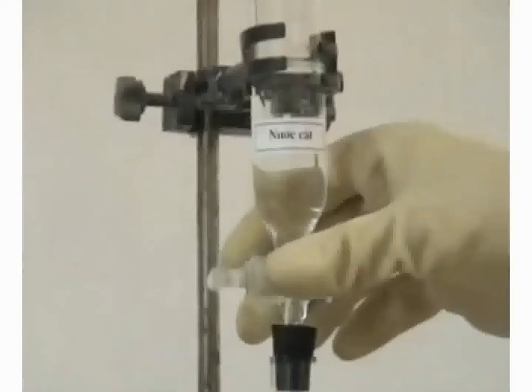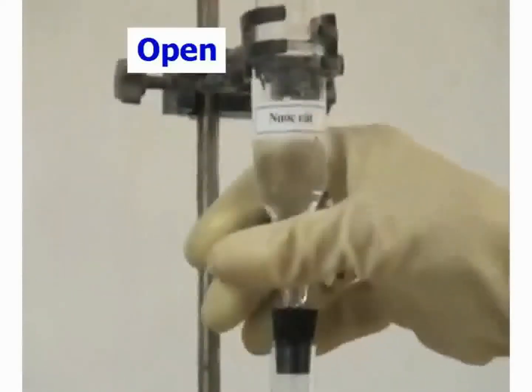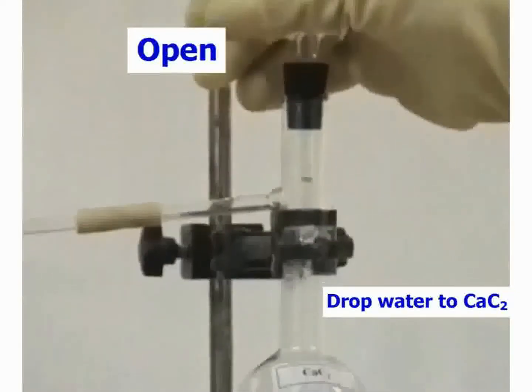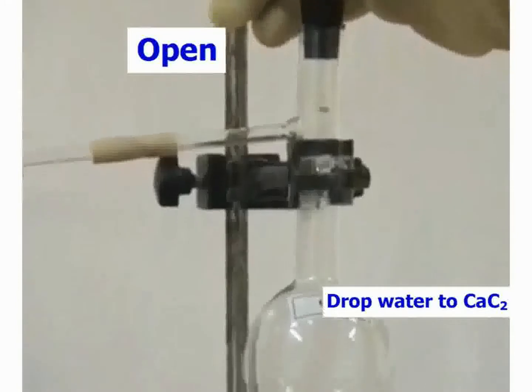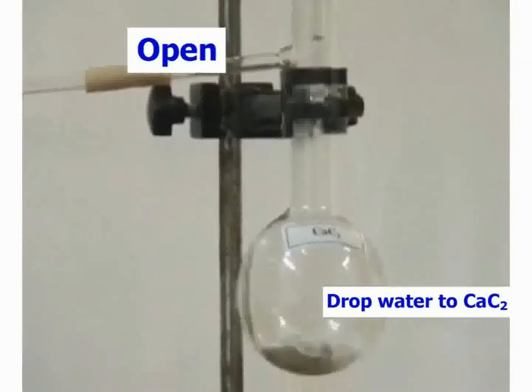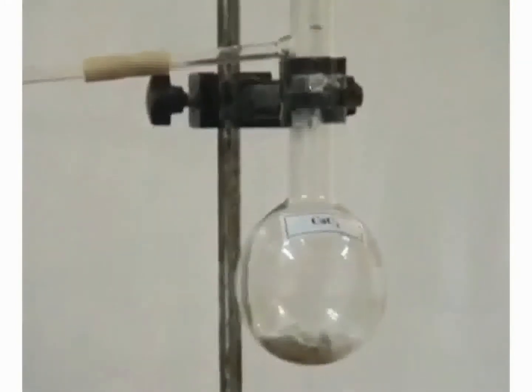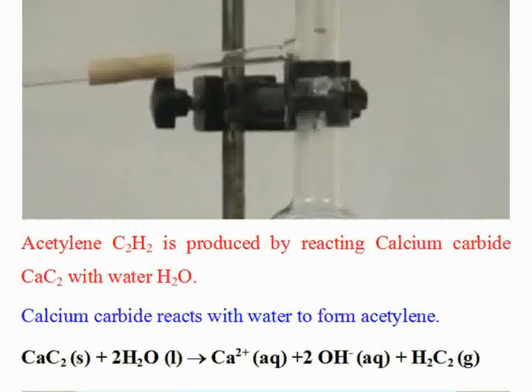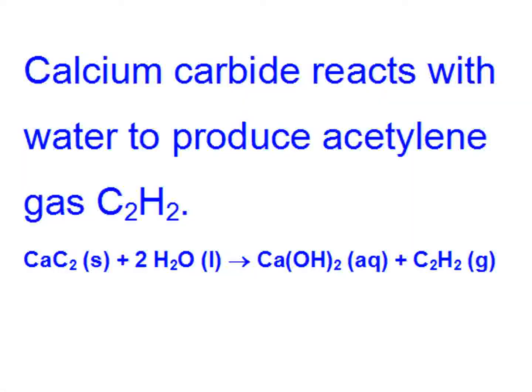Drop water into calcium carbide. Calcium carbide reacts with water to produce acetylene gas.